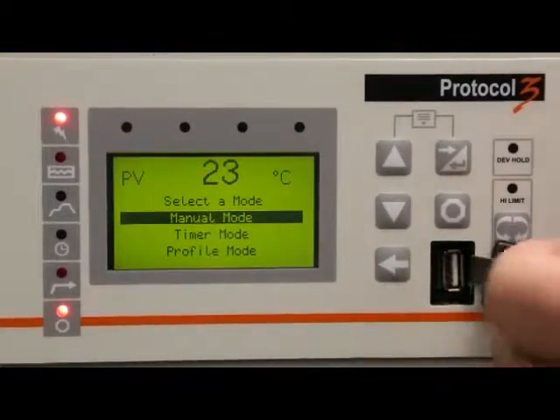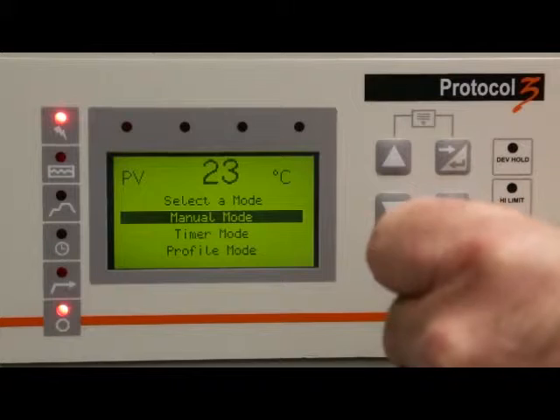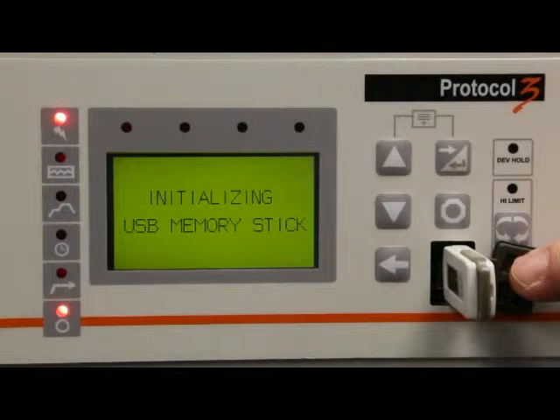Restore power to the oven and then insert the supplied USB flash drive to download the configuration file for your oven.